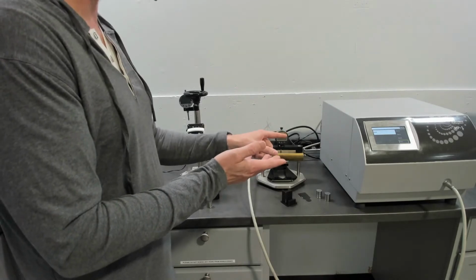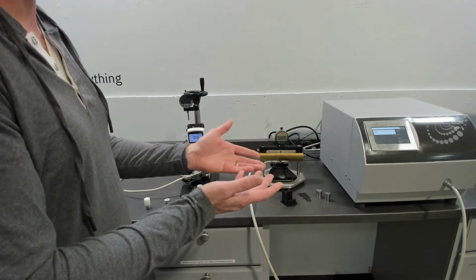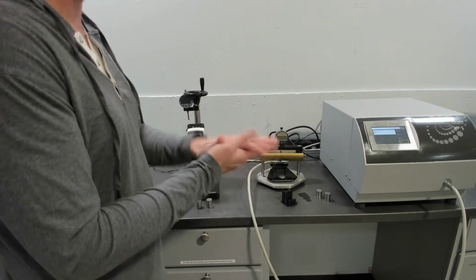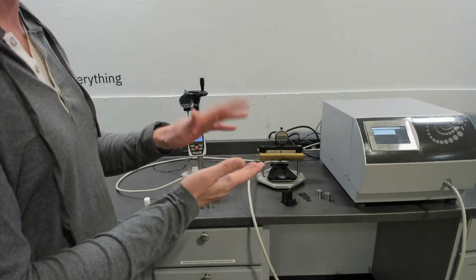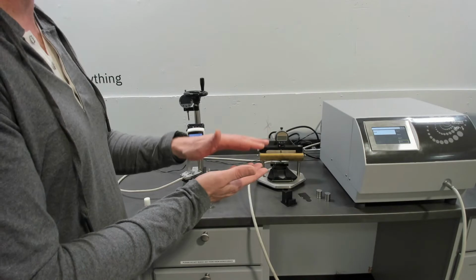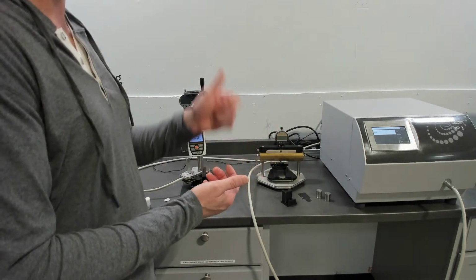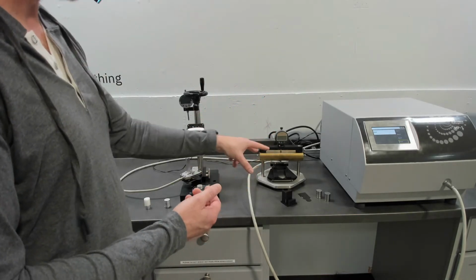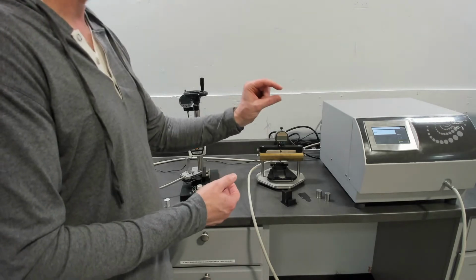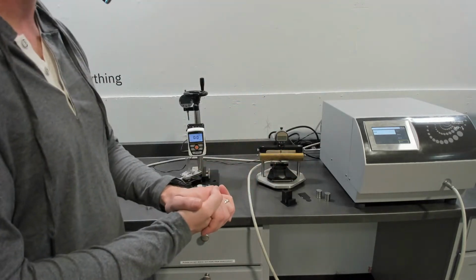If it's a freestanding film, of course that's not the case. In a freestanding film, if it has a soft surface like paper, that's the exception, and you generally can test one layer. But as you get more rigid type freestanding materials, you can measure 1, 2, and 3 layers, but only 1, 2, and 3. And this measurement only takes about 5 to 40 seconds, depending on the height of your sample and the thermal resistance that you introduce between those 2 materials.